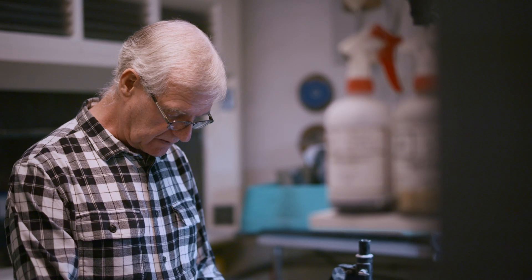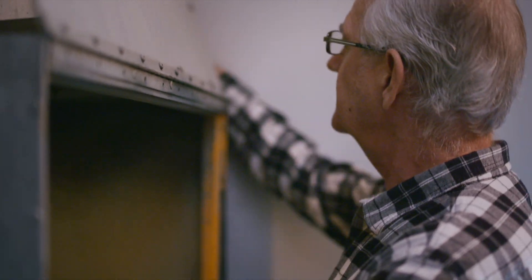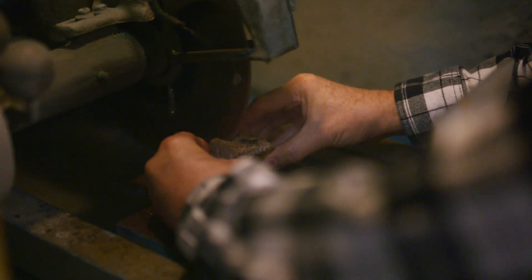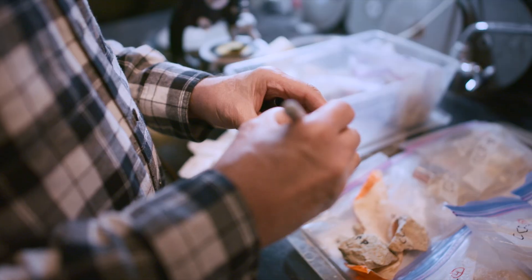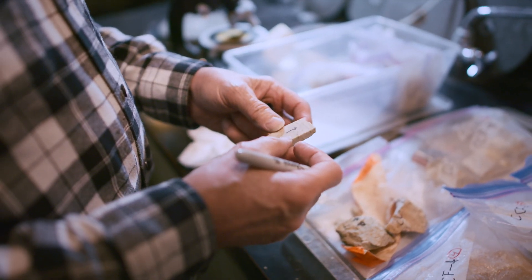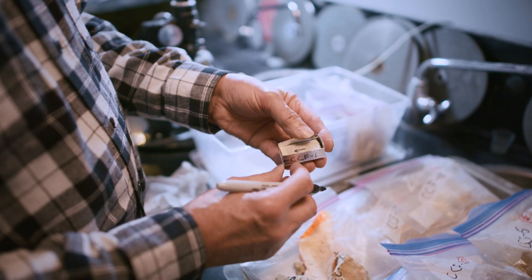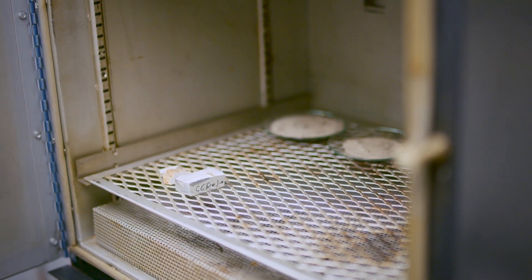Initially we need to cut these rocks, dry them, and get them prepped for thin section analysis. Right now I'm going to put an orientation mark on this rock to show what end is up. That will be crucial to determine how the bedding structure is affected by how the rock materials were originally laid down. That sample is now ready for drying in preparation for liquid epoxy impregnation.